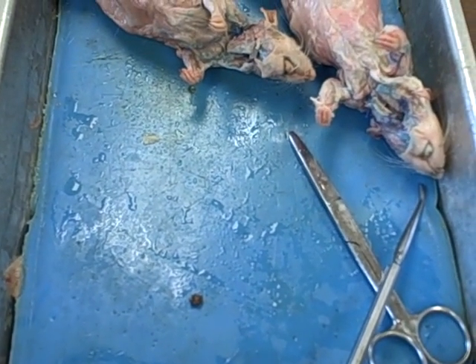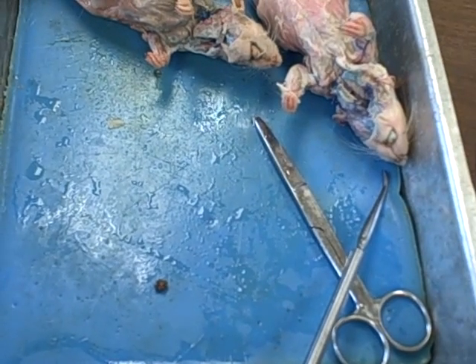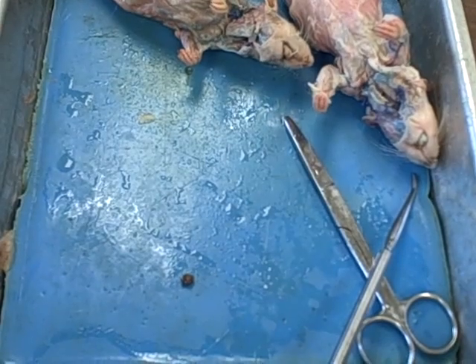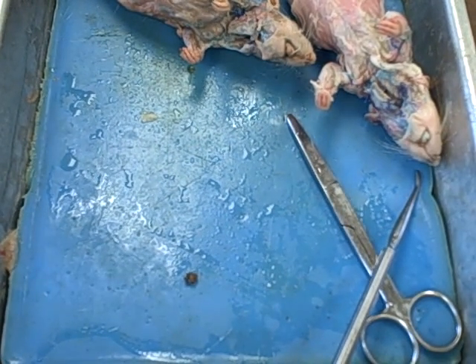This will be the first video on dissecting the rat. All the features that I will go through on these videos are features that I expect you to know for the practical coming up here on Thursday. Remember with these videos that you're still looking at the rat in just two dimensions. So it's still the same animal that you're going to be looking at, but it's still not the way you're going to be quizzed over it.